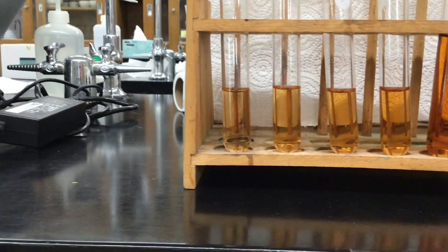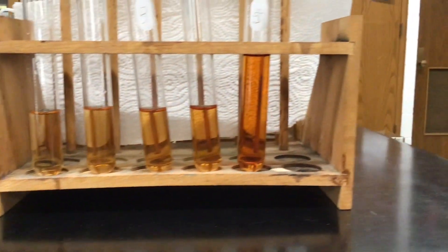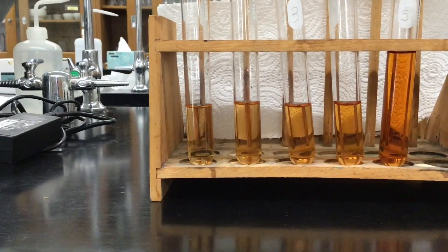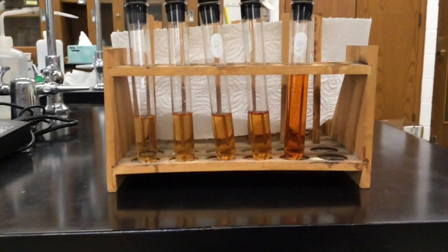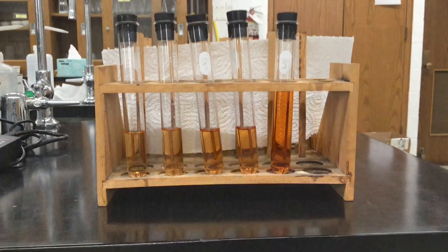Okay, here are our test tubes. Test tube one, two, three, four and then the standard at the end. It appears to me maybe on video you can see it appears to be darker. We're going to measure with the colorimeter in a moment to get quantitatively using Beer's law what's the concentration.